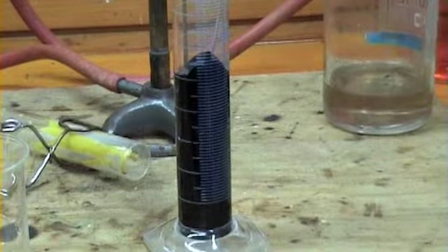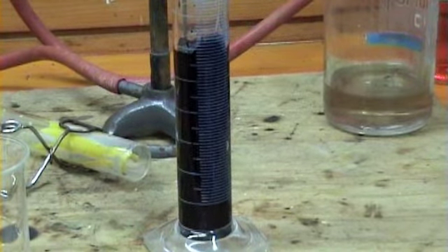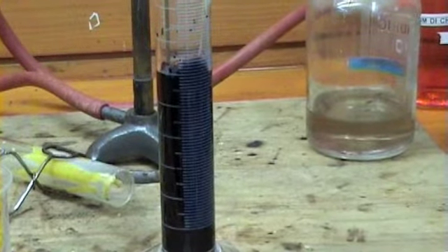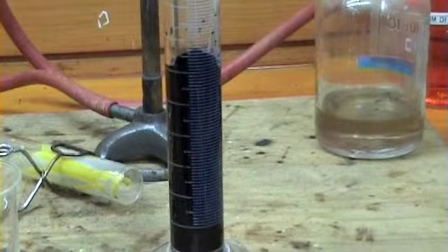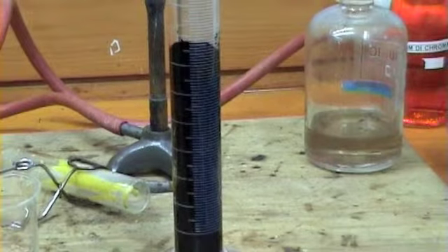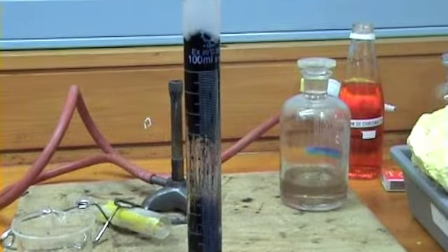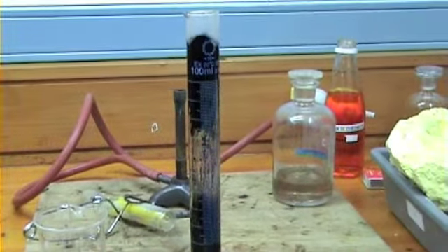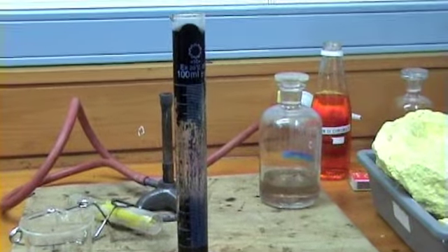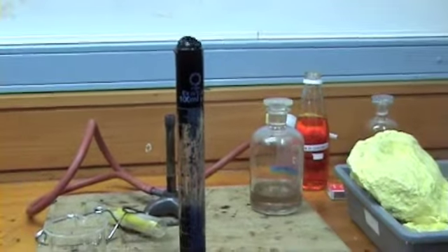What's boiling? Oh my god. It looks like tar. Please go up. Move it up. Oh no. It looks like tar, sir. Keep going. Zoom out. How does it increase with heat when there's no... Exothermic. Go. It's like a Satan. Keep on going. It's nearly there. It's nearly out. It's expanding. The water molecules are turning into steam, so it's expanding and pushing it up.